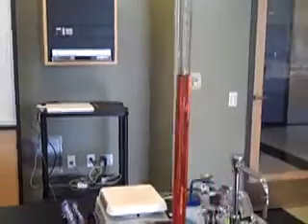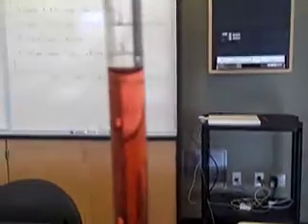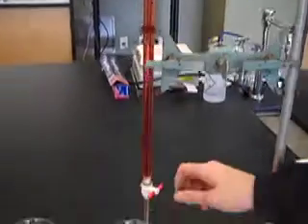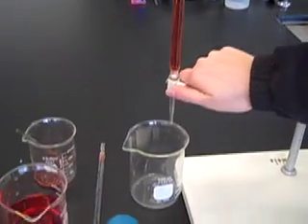Note the starting volume. Then, turn the knob to let the fluid run until you have reached the desired amount.